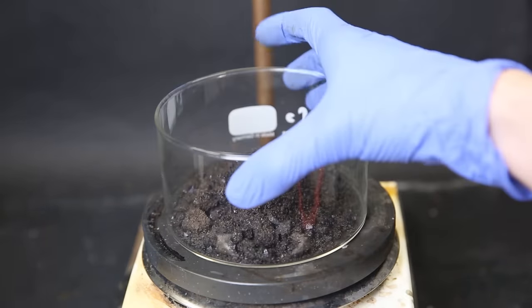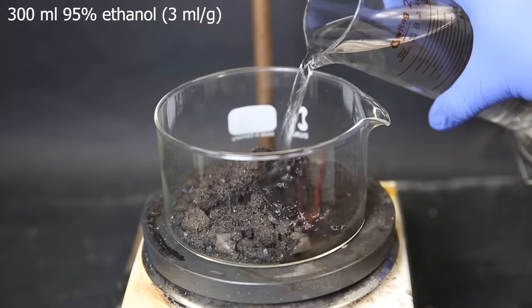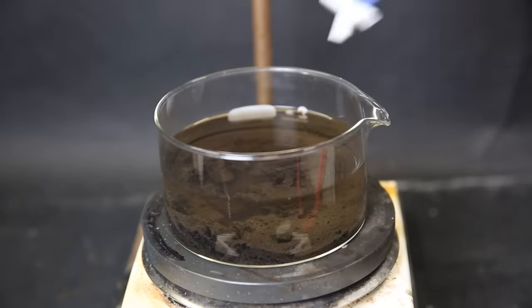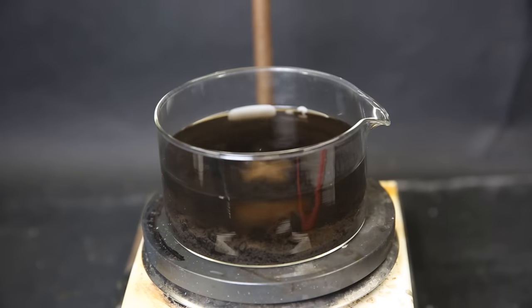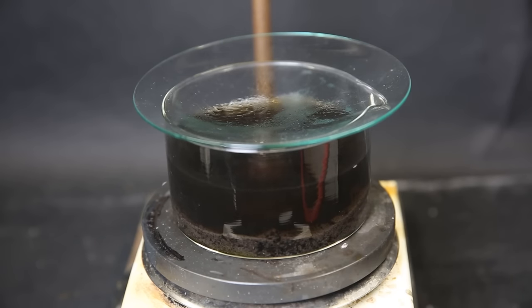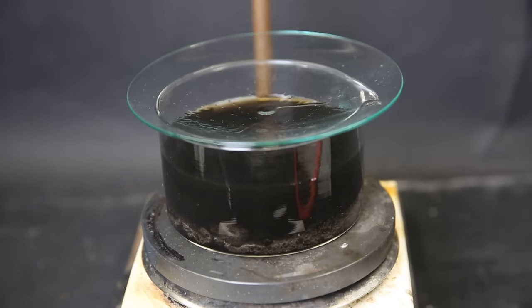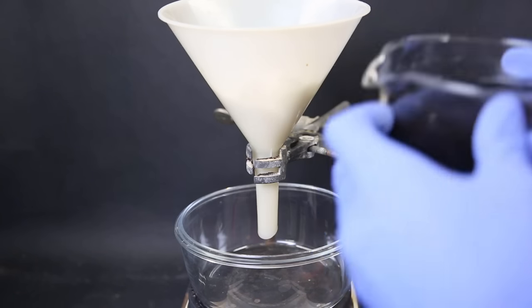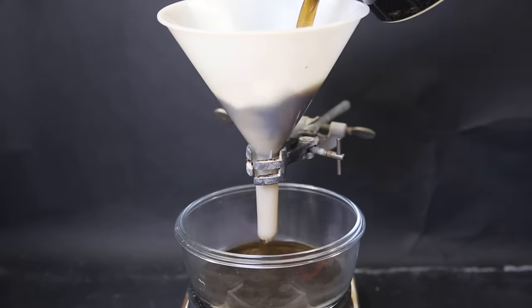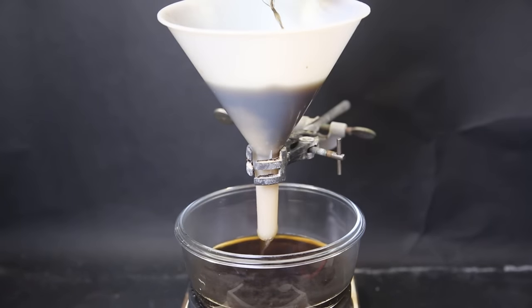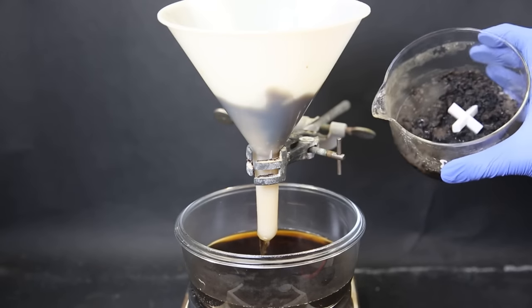Now I set the crystallizing dish onto a hotplate, and add 300 mL of 95% ethanol. I add a stir bar, and then start heating the dish. I bring it to a boil and move the dish around to dissolve as much of the solid as possible. While boiling hot, I quickly filter the solution through a cotton plug inside a large plastic funnel. We can see that still a decent bit of product didn't dissolve.